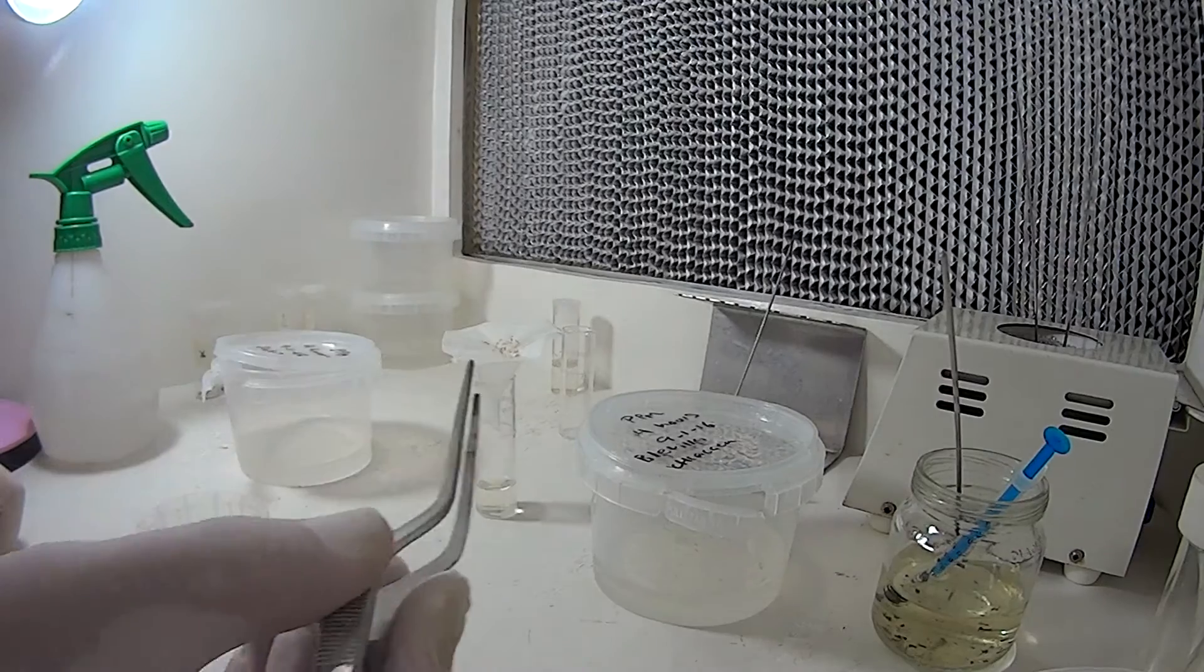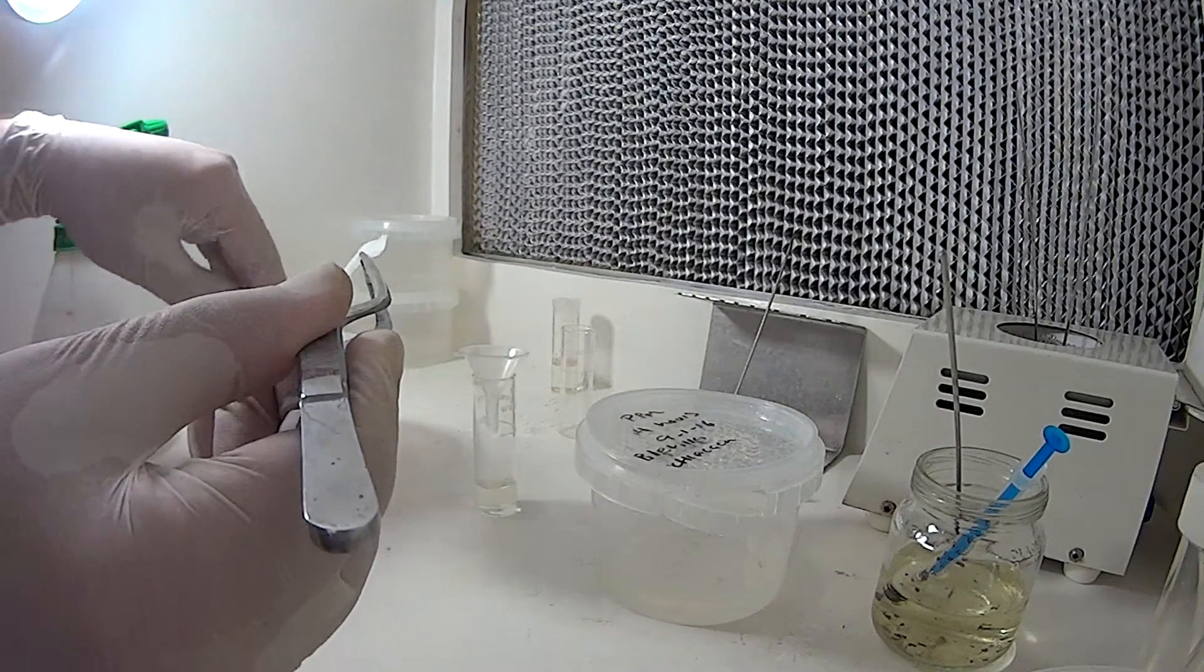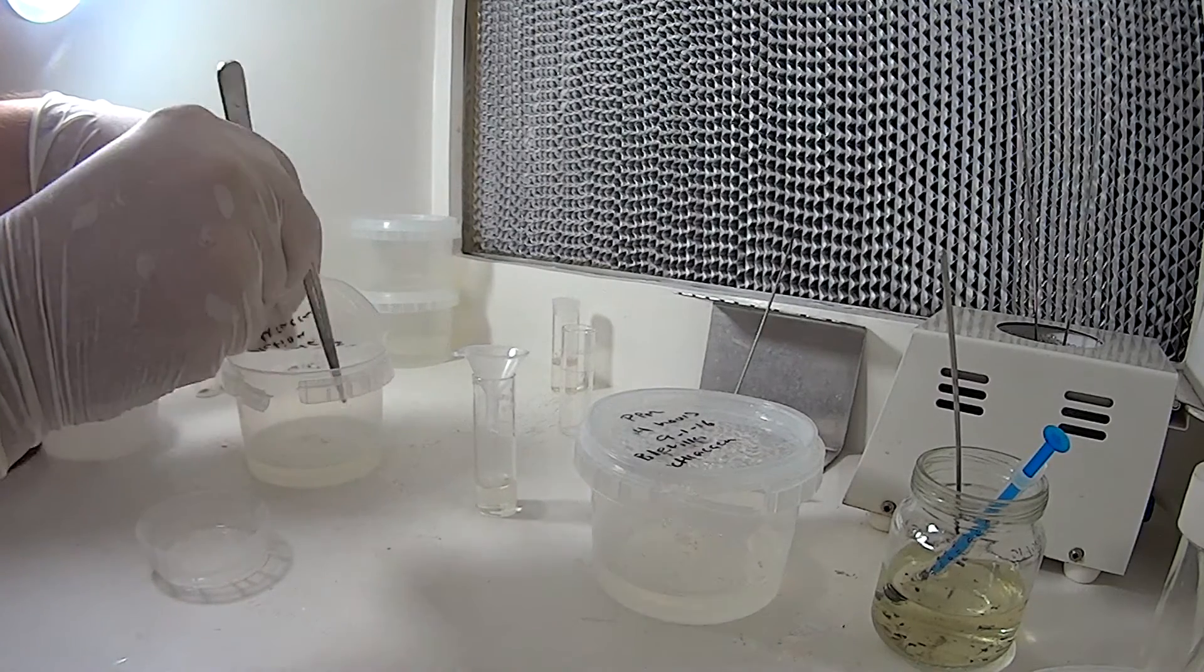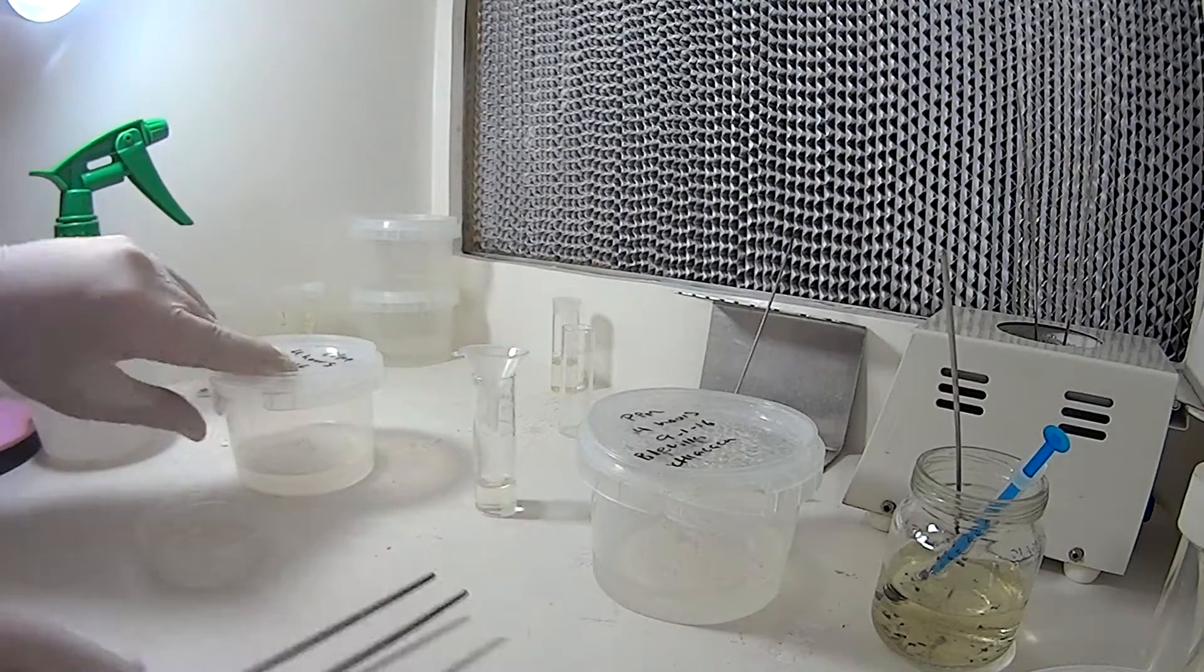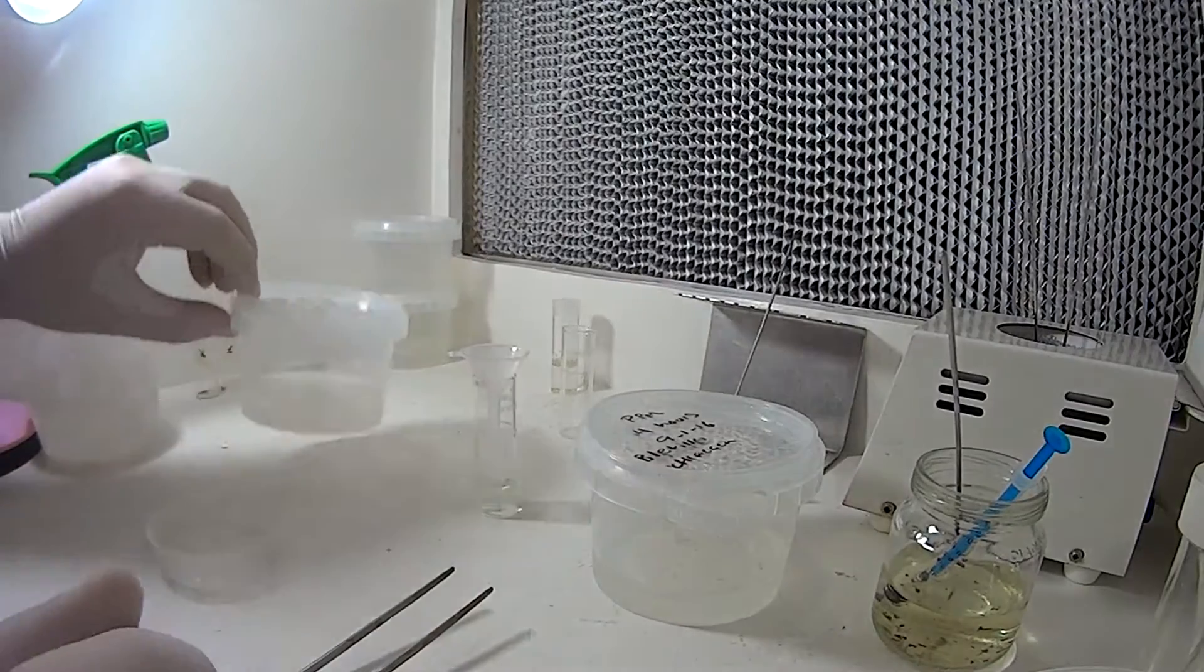I think we've got most of it out. Alright, soak the water off, take the whole filter paper and plunk it down in the container. Put it in the middle there, just make sure it lays down fairly flat. Saves a lot of time and effort. And there we go. Hopefully that grows and I'm going to get some little orchid plants happening soon.